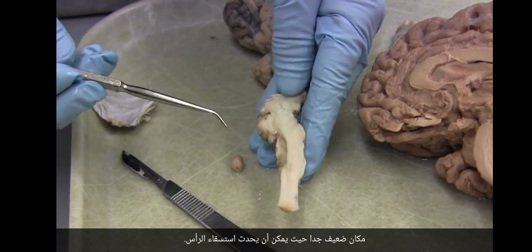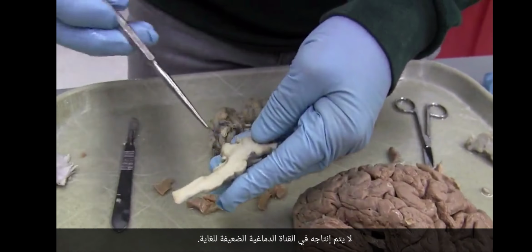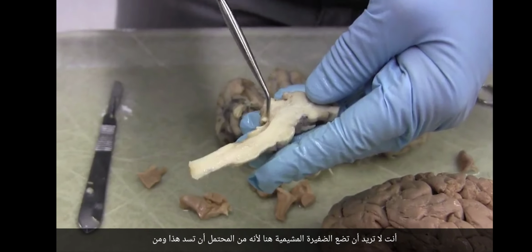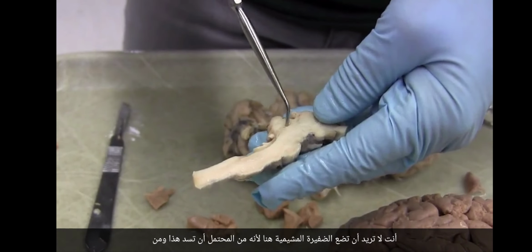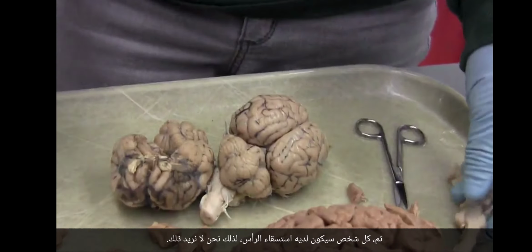And all along the way, there's this stuff, this choroid plexus. So CSF is being churned out of the lateral ventricles. It also gets produced in the third ventricle. It also gets produced in the fourth ventricle. It does not get produced in the very vulnerable cerebral aqueduct. You wouldn't want to put choroid plexus here because it would possibly clog this up, and then everyone would have hydrocephalus. So we don't want that.